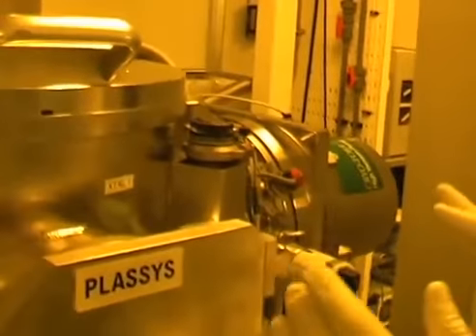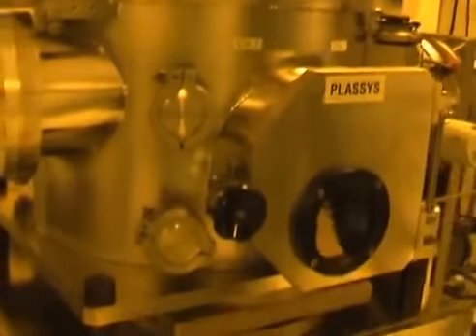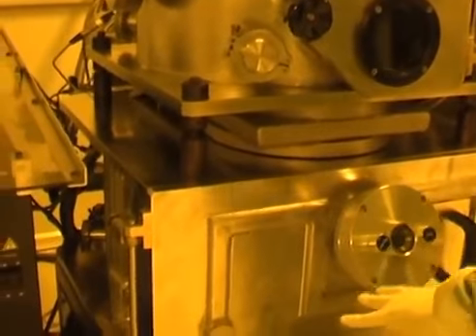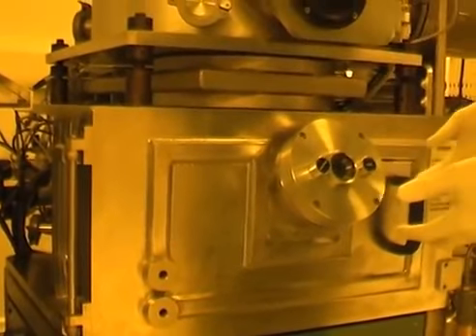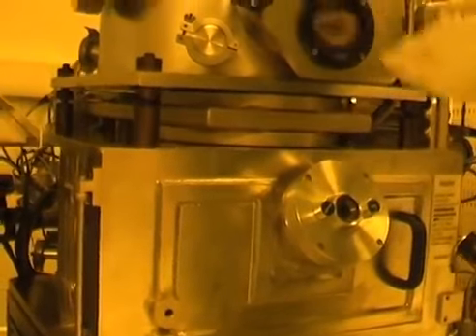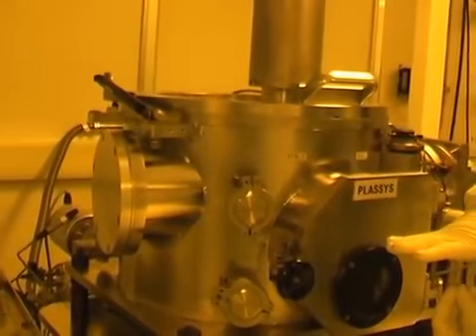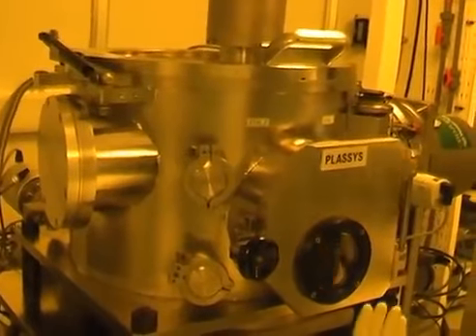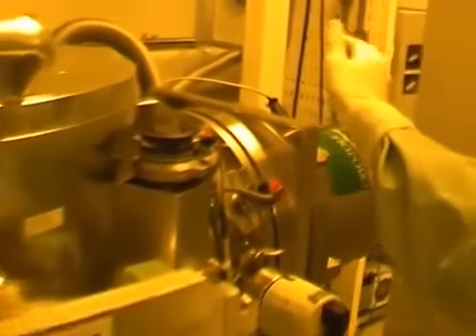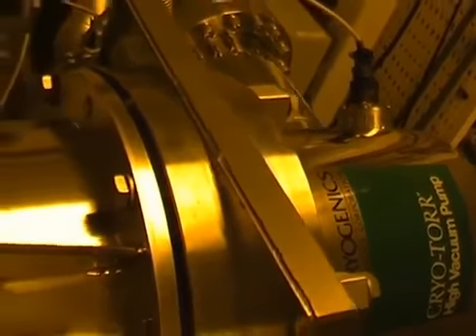As we go through here, we see the load lock chamber and the main chamber. The main chamber is the one where the crucible is, and that's where the electron beam is generated to melt the metal, which then evaporates towards the load lock chamber where our sample is upside down, ready to be deposited with metal. This is a cryo pump, this one that you see here. It's a high vacuum pump that will pump the load lock chamber.